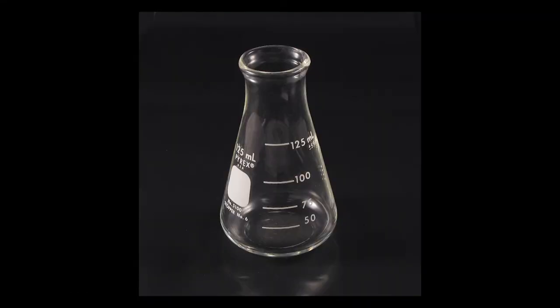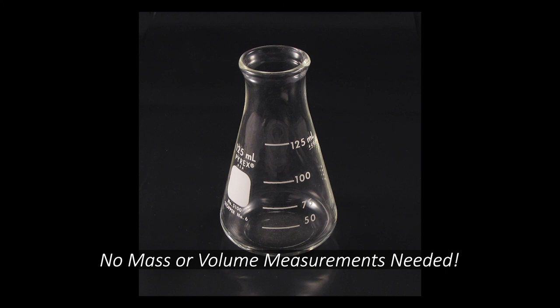Just one more thing before you go. The last part of your procedure will ask you to describe what an Erlenmeyer flask looks like. You don't have to take any mass or volume measurements with it, just describe it. And that's your procedure.